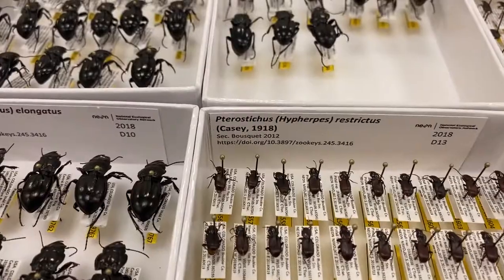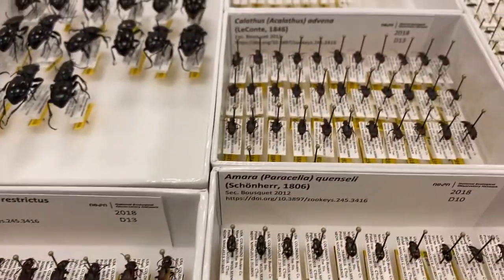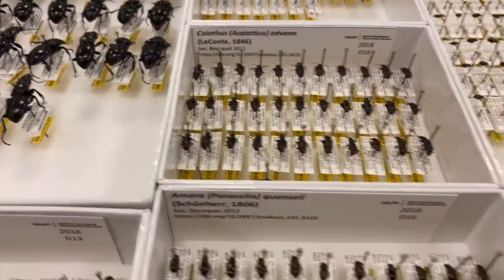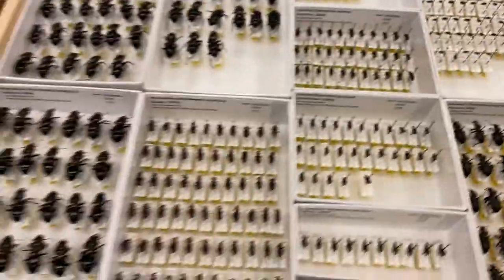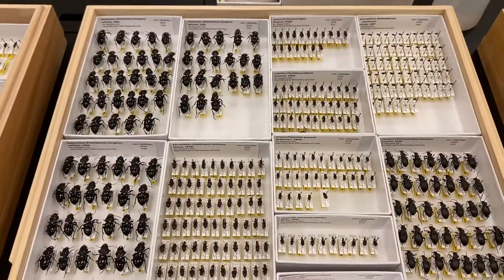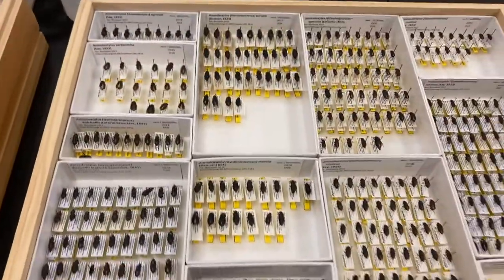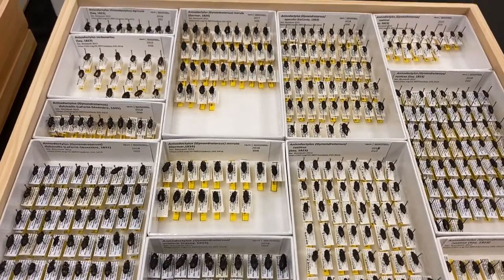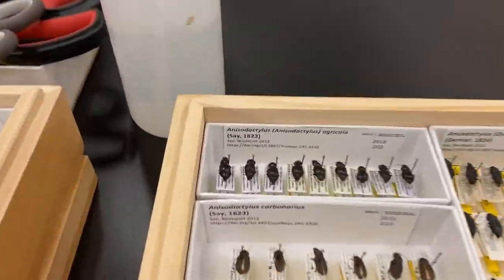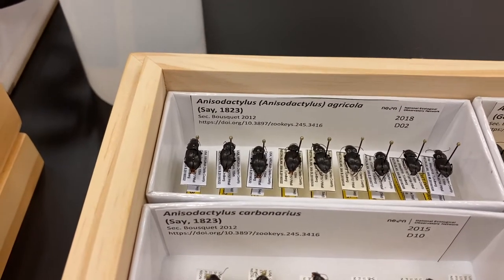Over here we have a Pterostichus species, an Amara species, Calathus, and down to Carabus. Eventually all of these need to go into the collection. Here we have a drawer of all Anisodactylus, and we can see these are now alphabetically sorted by both subgenus and species.